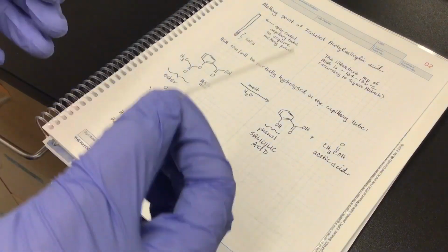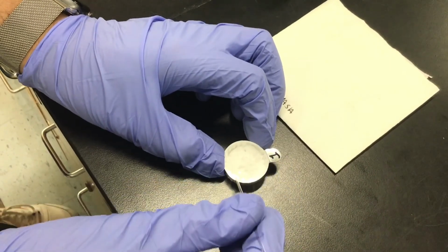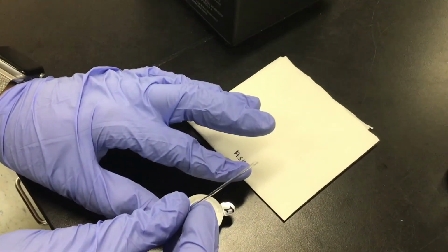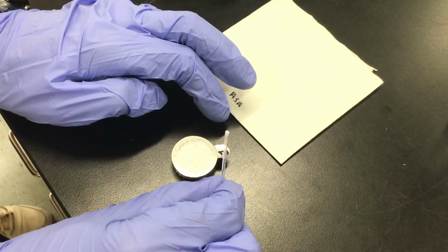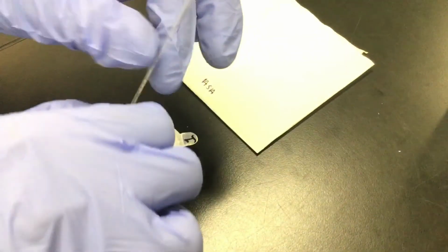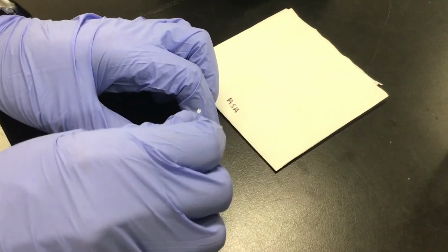All right. So in terms of collecting solid, what you're going to do is that you just need a little bit. You just very lightly pat down on the solids you've collected after you've taken the weight of the thing, and you just gently tap on the lab bench to try and have the solid go down into the tube. But you'll see that sometimes that doesn't work so well.